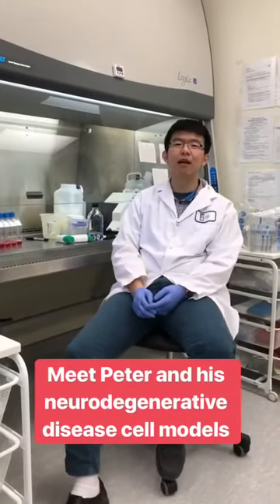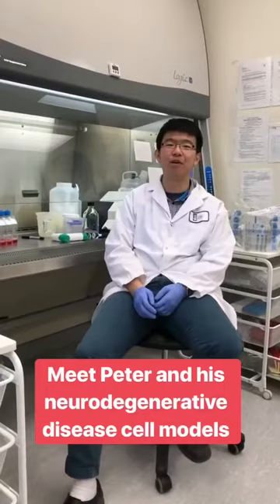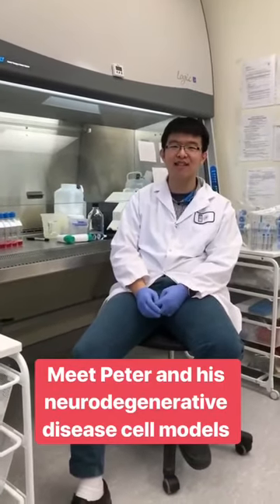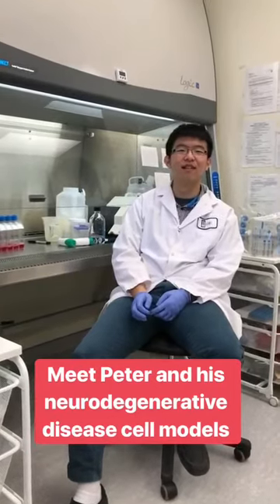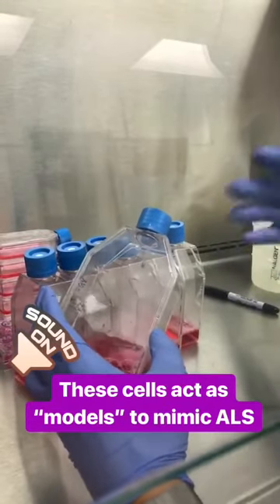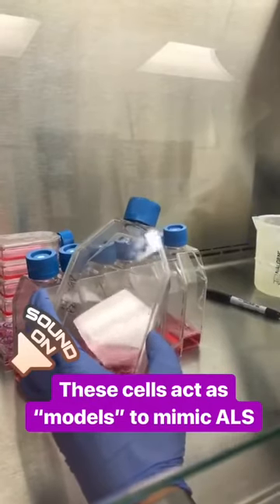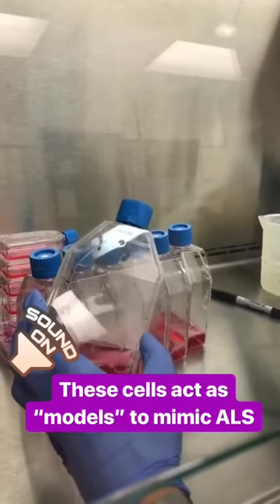Hi, my name is Peter. I'm in my third year studying in the Bachelor of Health Sciences program. My project in the Miller Lab uses the CRISPR-Cas9 system to create cell models to study several neurodegenerative diseases. Each of these flasks contains a specific deletion in the gene that we're trying to study, which allows us to better study the function of that specific protein.